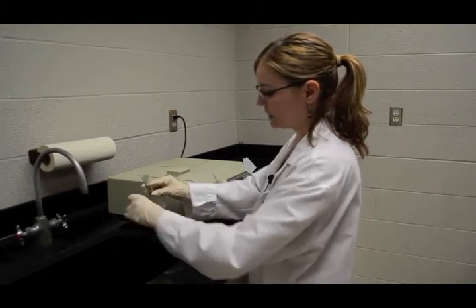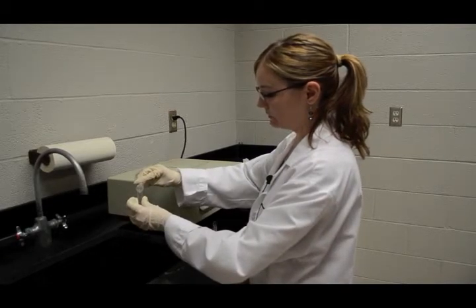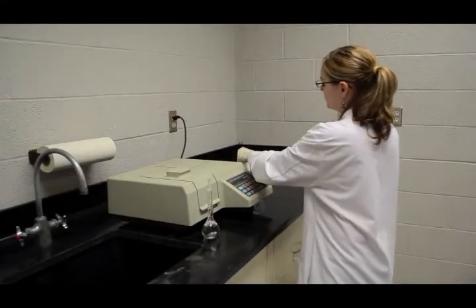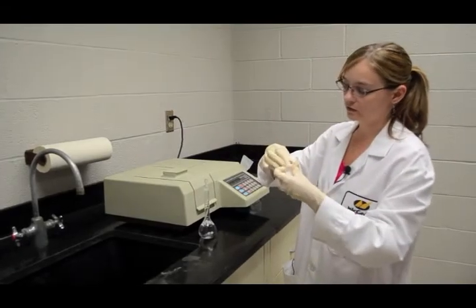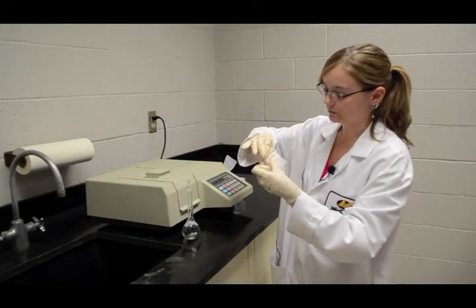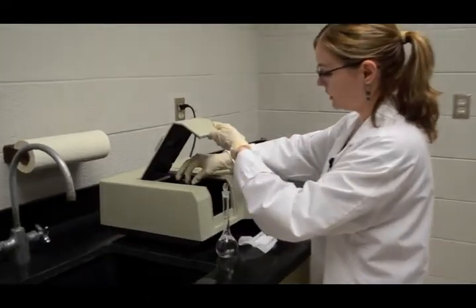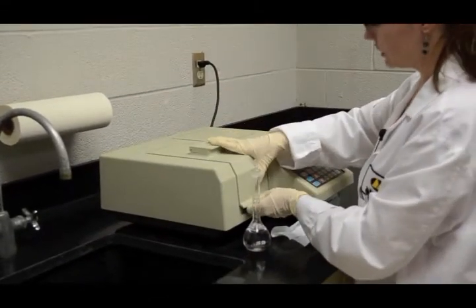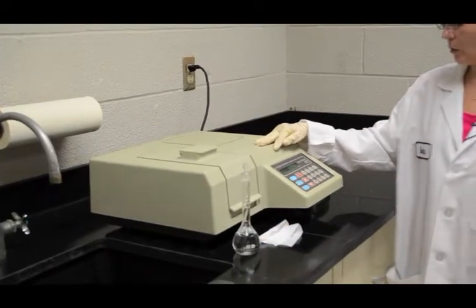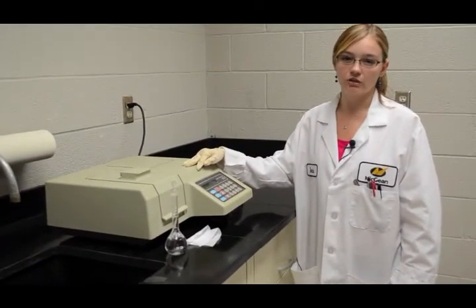I'm going to make sure that we rinse out the cuvette with the sample before filling it up. And then we're going to wipe down the cuvette to remove any liquid or sample that may be on the outside that would create a false reading. And then place it in the spectrophotometer and close the door tightly. And the absorbance unit of 0.681 will be recorded for the calculation in determining the percent concentration.